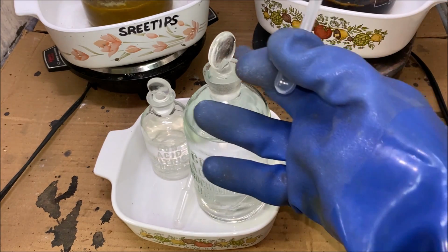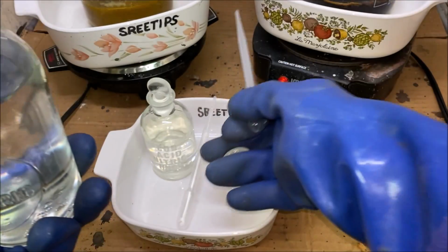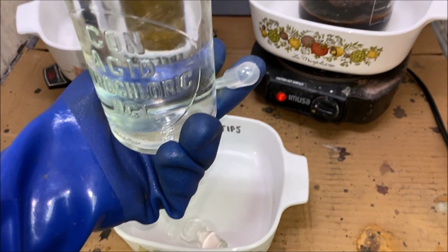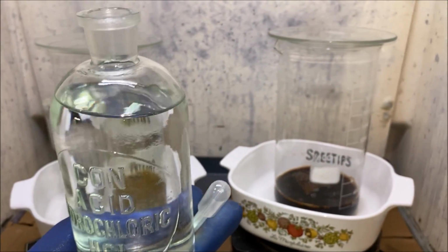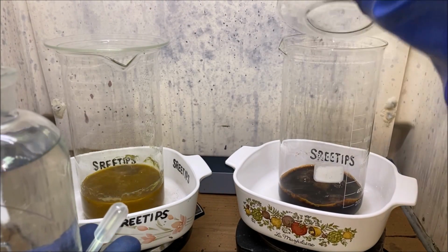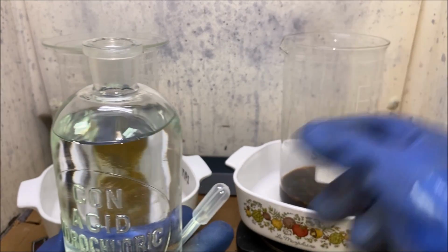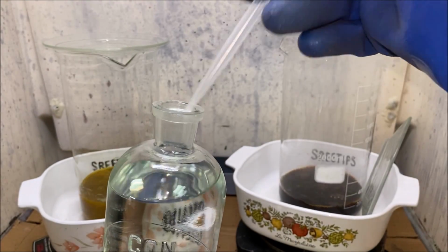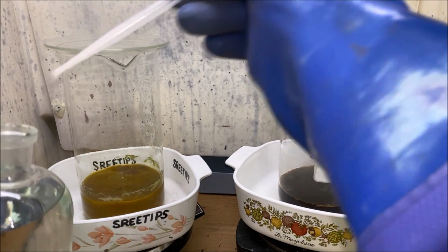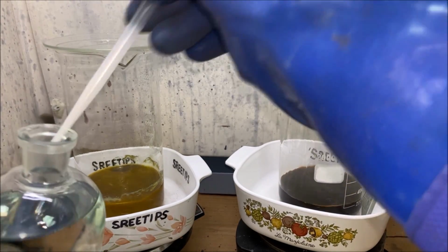I'm going to use some hydrochloric acid here. And we're going to rinse down the inside of these beakers with some hydrochloric acid. I don't want to use water because water forms some very strange precipitates. So we're going to rinse down the insides of these beakers with hydrochloric acid.